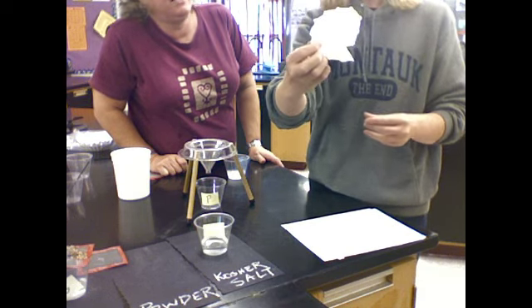And if I don't stir it well, then it won't travel with the water as I pour this. So here we go. This is like a magic trick. You put in cloudy water and ta-da! Let me turn the label so people can see. Wow. And the clear water comes through.